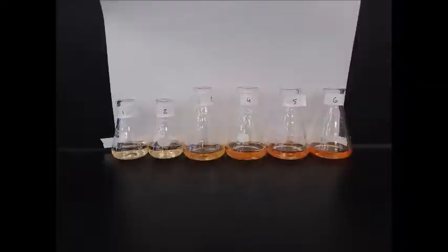Here's an image of our 6 reaction solutions. Again, because each of them has a different initial concentration of our 2 reactants, we have a different final concentration of our complex, and the solutions tend to get darker as we go from solution 1 to solution 6. But please remember that even though the equilibrium concentrations are all different, the equilibrium constant value should be the same.